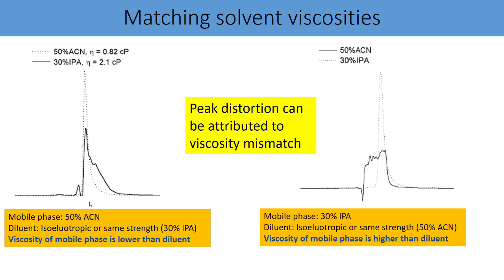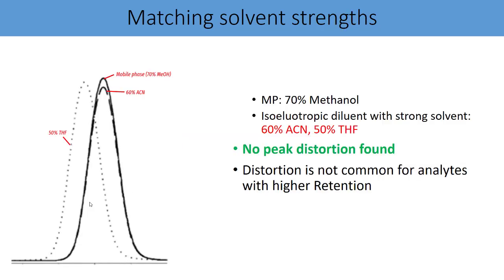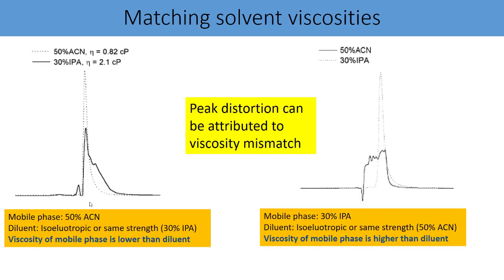Now, in the earlier example, let me go back just. We said that if we match the solvent strength and the mobile phase strength, our peak shape is going to be fantastic. But in this case, even though they are isoeluotropic, 50% ACN and 30% IPA are having equal strength, but look at the peak shapes. Are they acceptable to you? They are not at all.